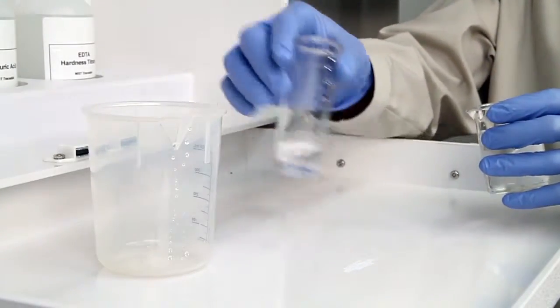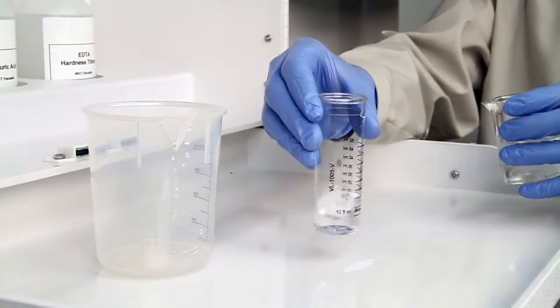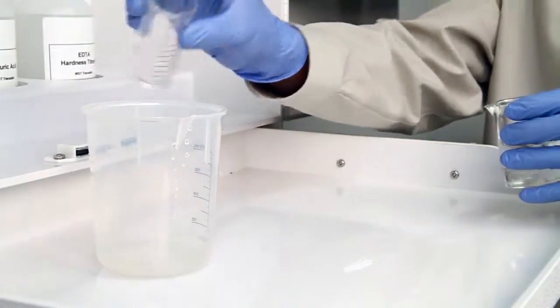Before you begin your test, it's important to rinse the vial three times with the sample to be tested. This minimizes the chance of contamination from a previous titration.